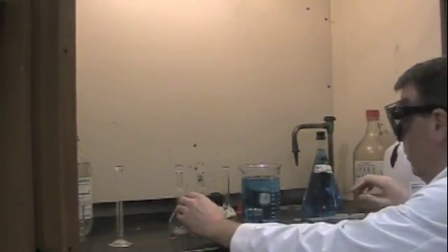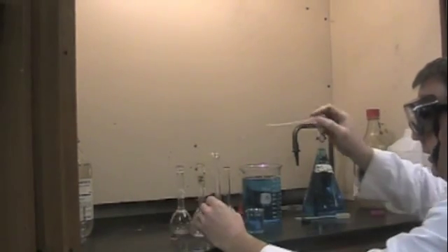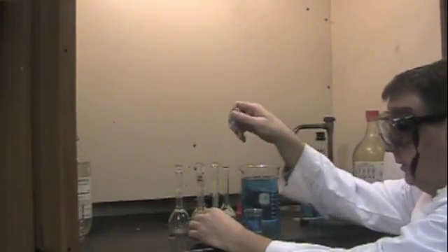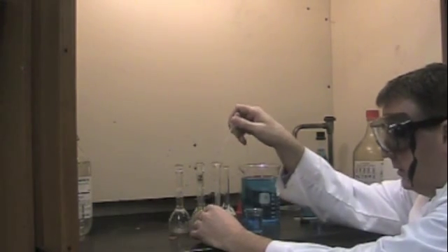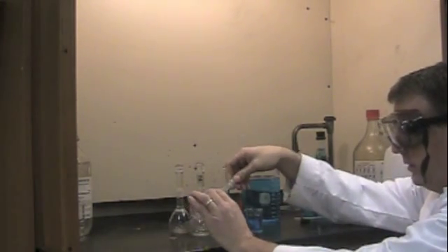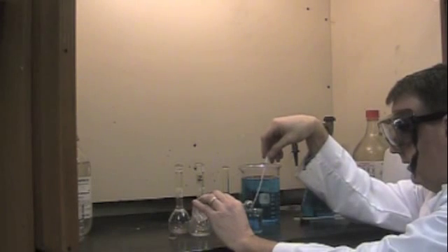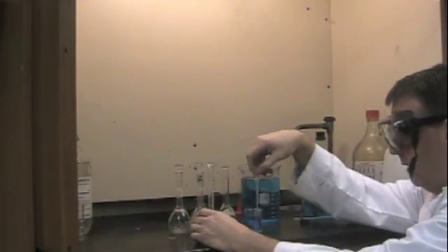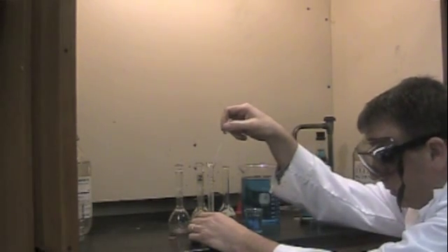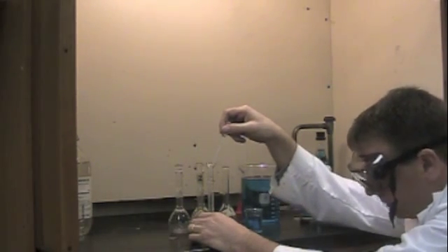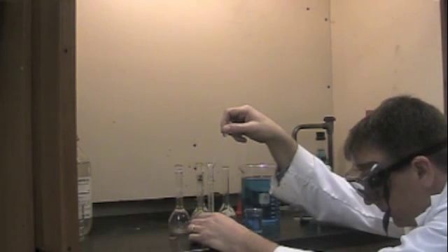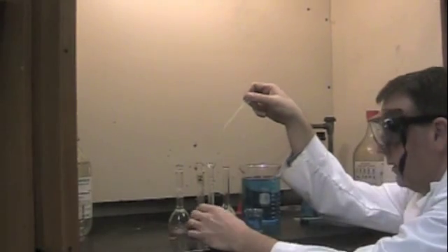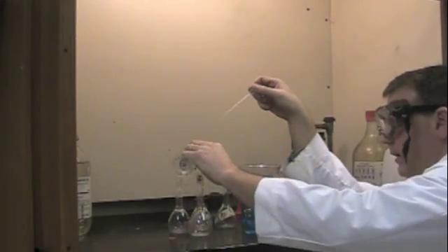The one that's labeled 2, you're going to want to put 2 milliliters of the standard solution. And it's important to measure very carefully here because a Beer's Law plot is only as good as the measuring that gets done to make it. So if you measure wrong, your Beer's Law plot will be way off. So I'll put in exactly 2 and pour that into the bottle labeled 2.